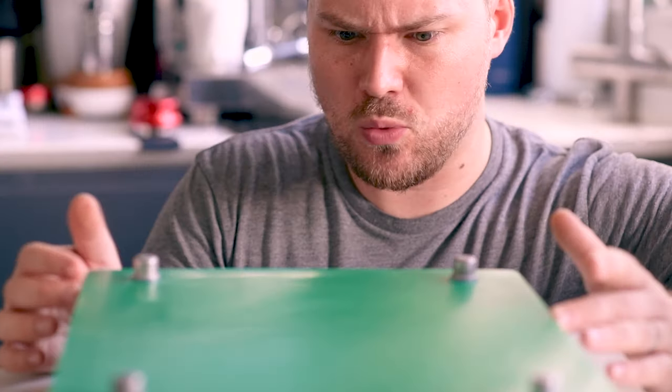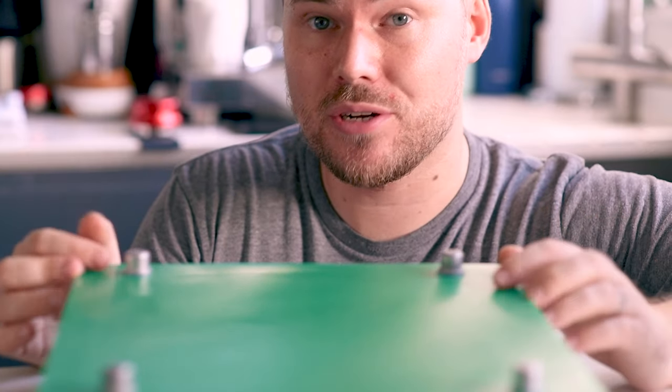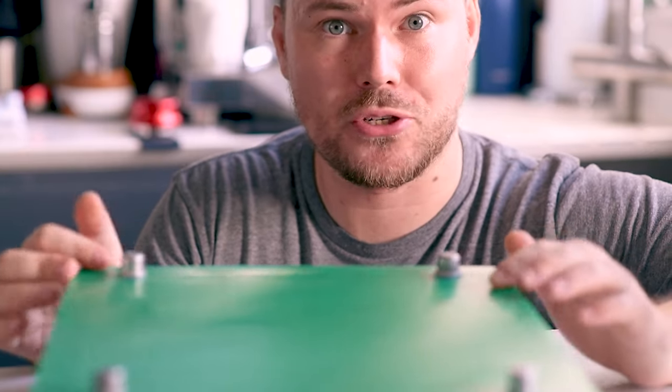Whether it's my morning espresso or another household item like this 5-litre industrial borosilicate or Pyrex beaker, I often find the need to swirl things, but as you know, trying to do that by hand is a complete waste of time. The problem being, industrial wobble tables like this or orbital shakers are expensive because they've got the word pharmaceutical or laboratory in their name.